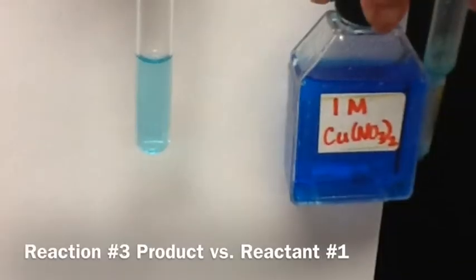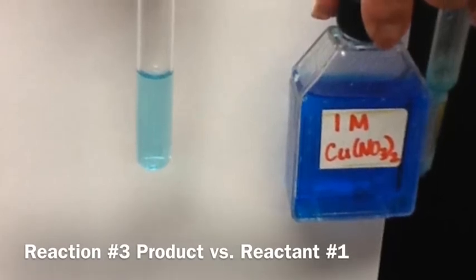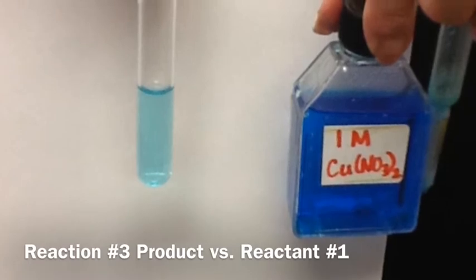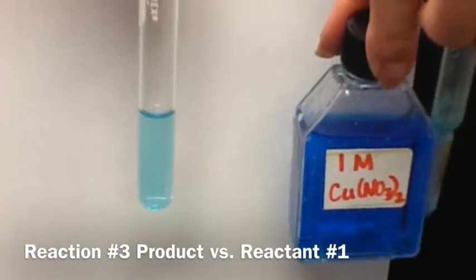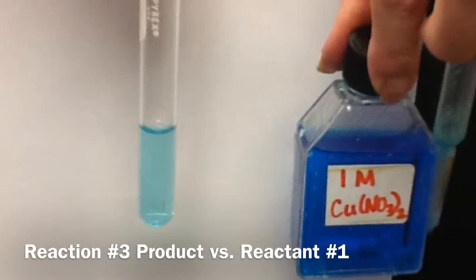This photo shows you the difference between the copper 2 chloride in the test tube and the copper 2 nitrate that you started with. Notice that the copper 2 chloride isn't just a lighter blue, but it's a slightly different type of blue, and that's an indication that the substance in the test tube is different from the substance that you started with.